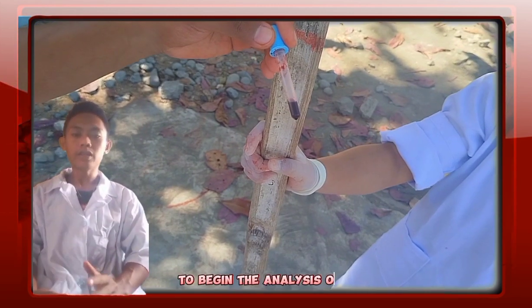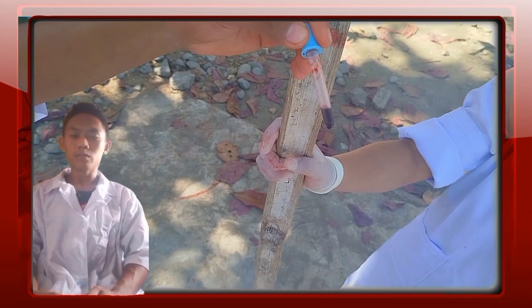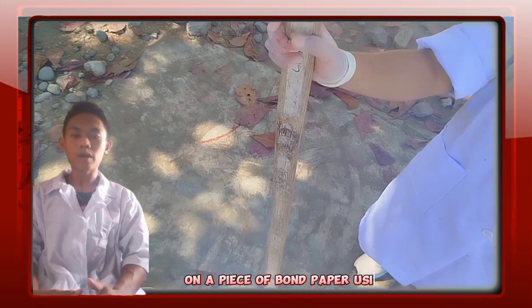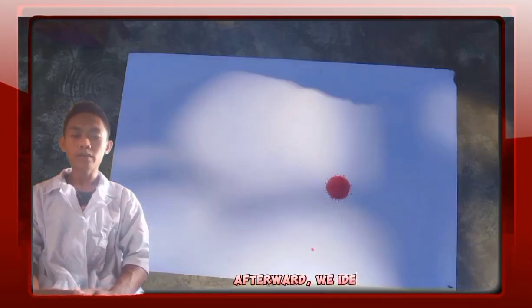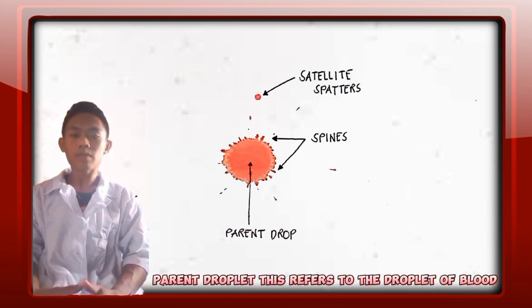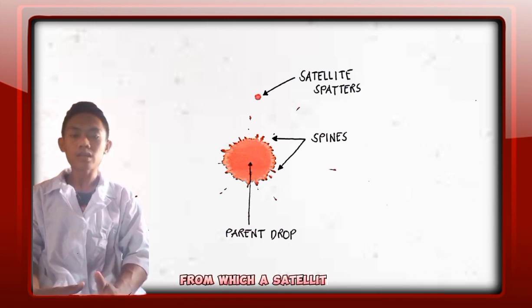To begin the analysis of the blood spatter, we start by placing 1 ml of the suspected blood on a piece of bond paper using a dropper. Afterward, we identify its fundamental components. These components include the parent droplet. Parent droplet refers to the droplet of blood from which a satellite spatter originates.